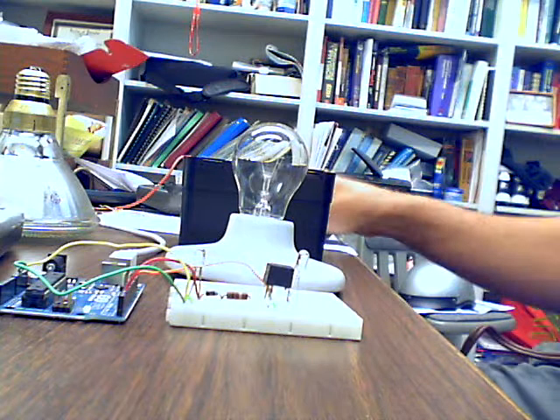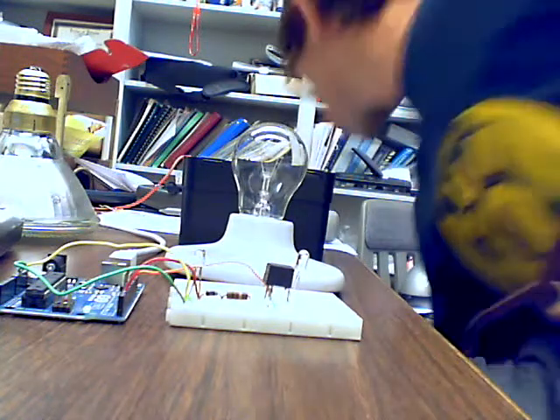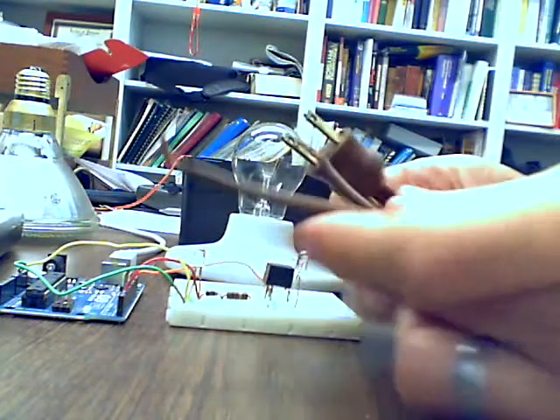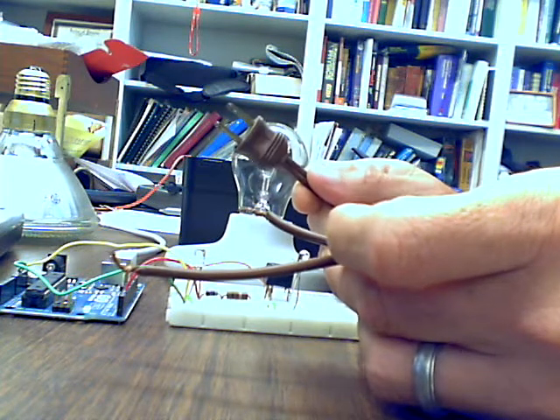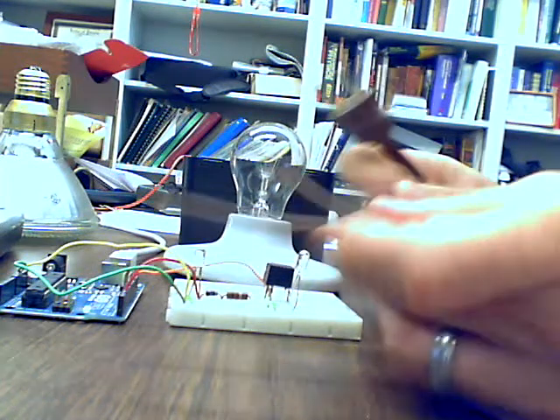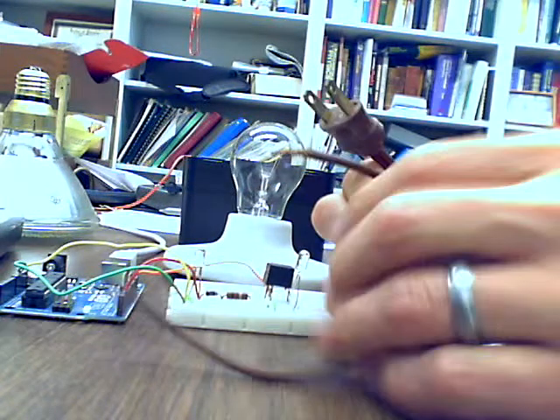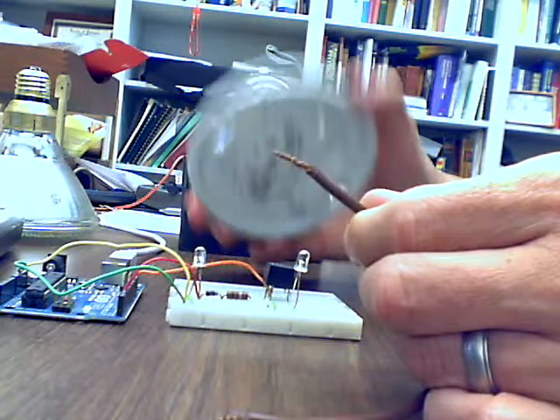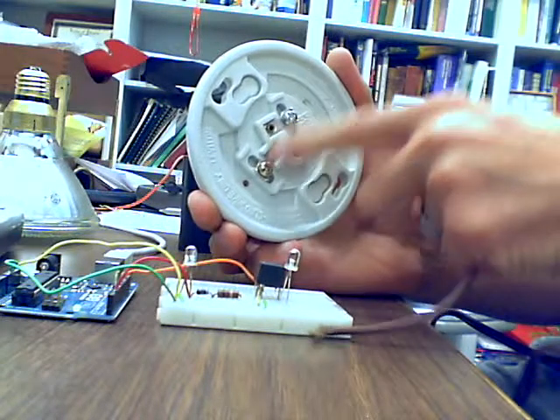The things you're going to need are a screwdriver. We also have what they call a lamp cord that you can buy at a hardware store. On one end it has the electrical plug that you plug into an outlet, and on the other side it just has two exposed wires. And what we do is we just take one of the exposed wires and connect it to the light here. We can connect it to either one of these.